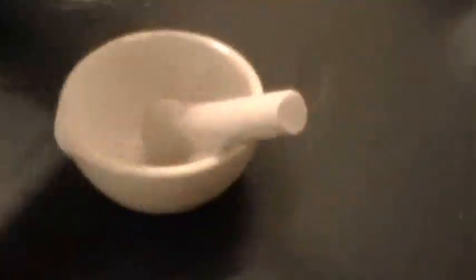Nicole's adding the calcium carbonate — full of energy. We need to give it a swirl. Check out that swirling action — make sure we get all the reaction going, it's like a tornado in the beaker.